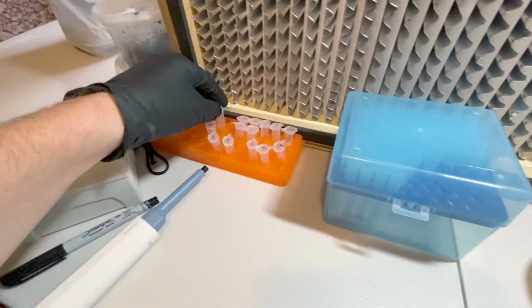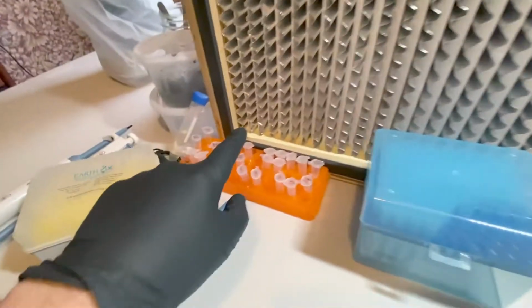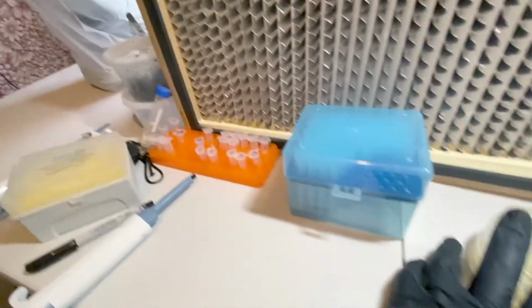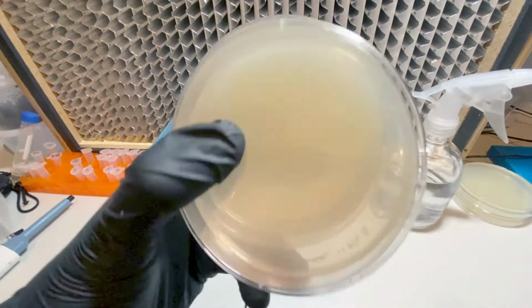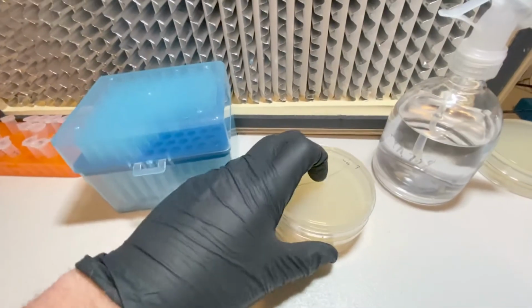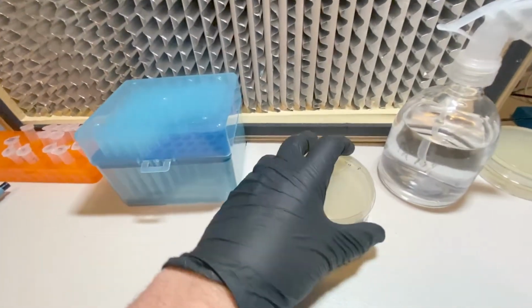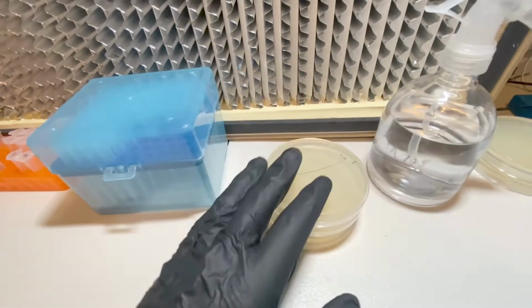And so that's what I'm going to do right now. I'm going to take 3 of these tubes and put some LB broth in them with some kanamycin. And if I see some outgrowth of the colonies that have grown along the outer edges of these plates, then that's great. That does confirm that the electroporation procedure is working, but it doesn't answer what's going on with my plate spreading technique.